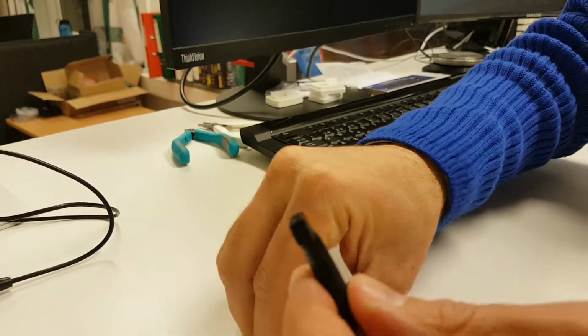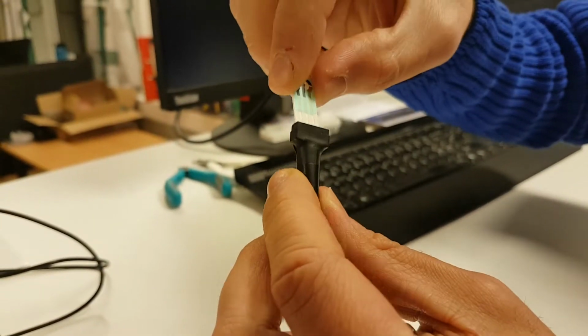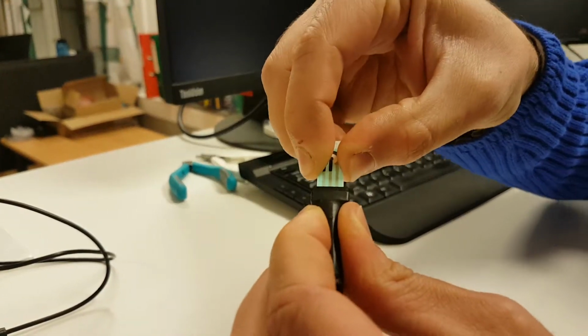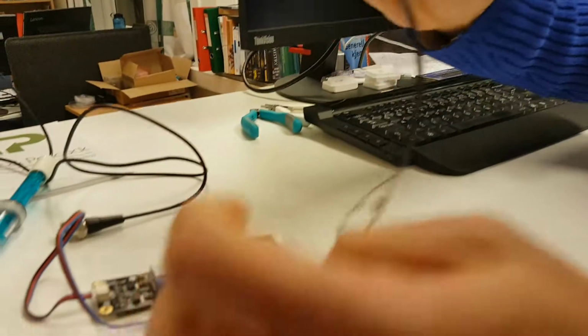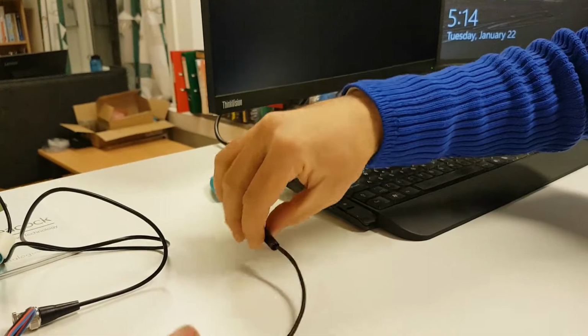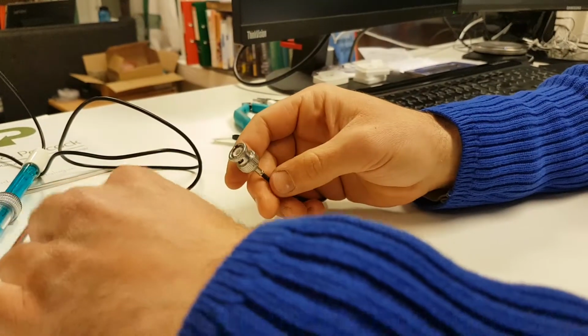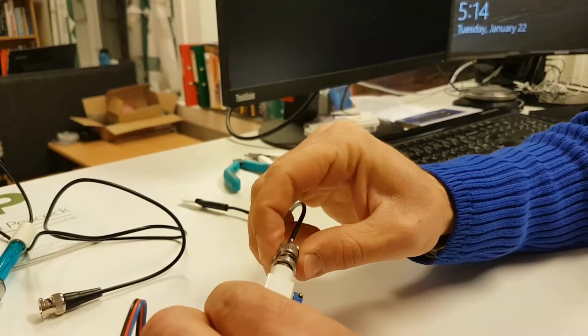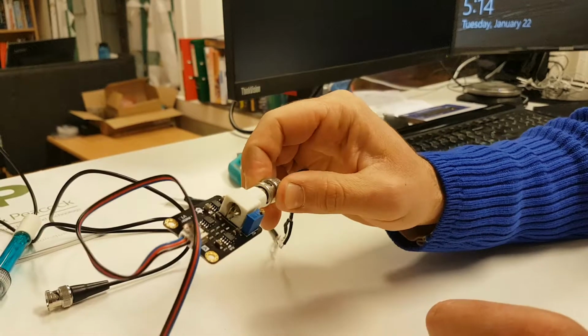So basically, once you connect our electrode, our sensor substrate, to this connector, what's going to happen is that the working electrode, the center electrode here, is going to be directly going to your interface board that came with the gravity probe, and from here you can connect it to the Arduino.